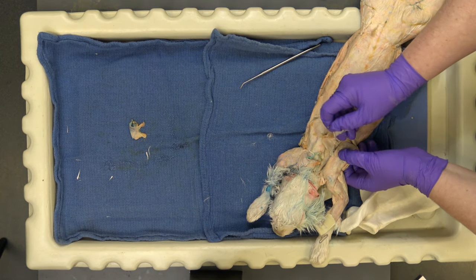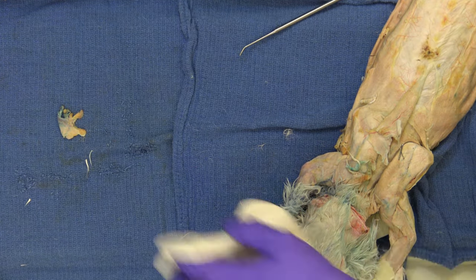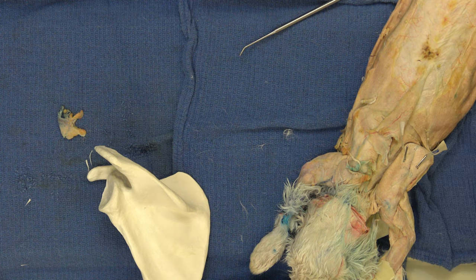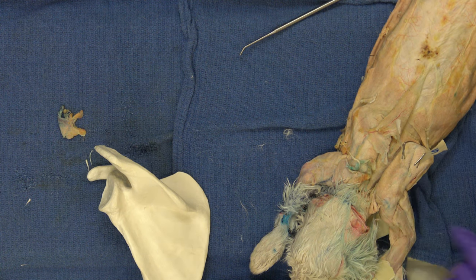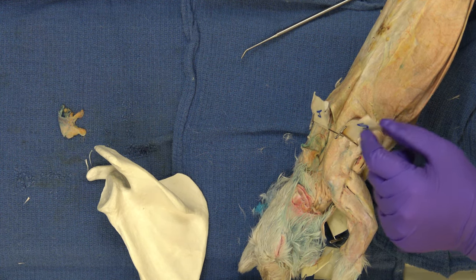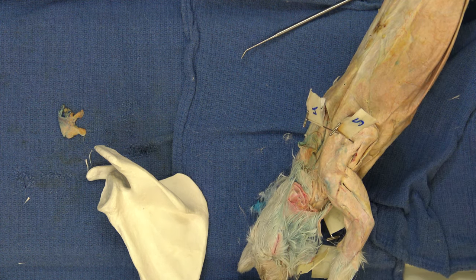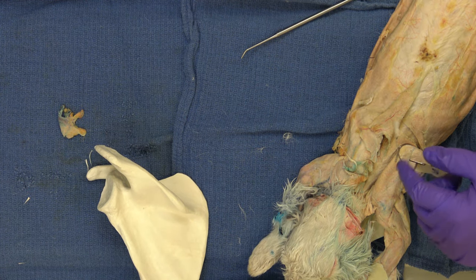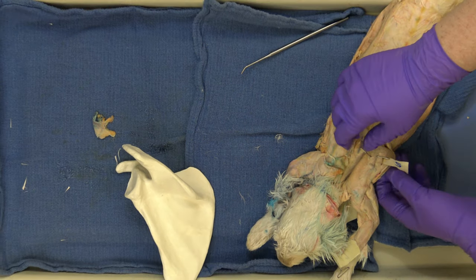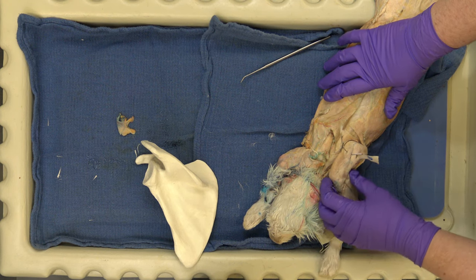On the dorsal aspect of the spine — here's a human scapula — on the side that's more towards the midline, on top of that is the supraspinatus. That's why it's named that: relative to the spine. So we have the supraspinatus, and then we have the infraspinatus. Supraspinatus on this side of the scapular spine, infraspinatus here. If you are asked this, probably both will be pinned in a photo and you'll have A and B and be asked which one.